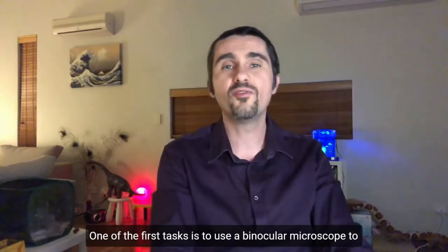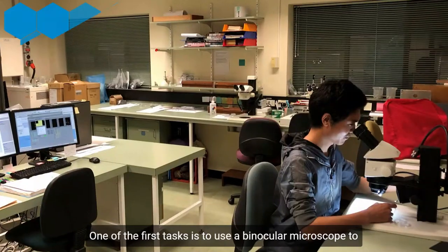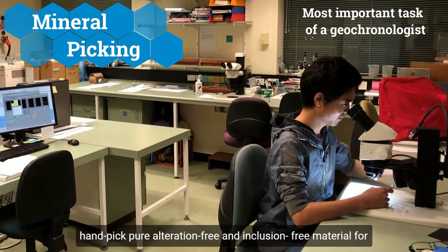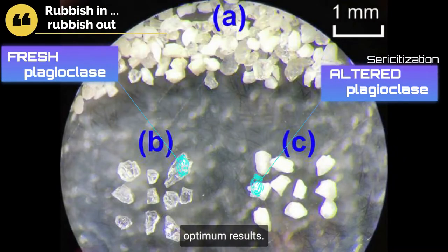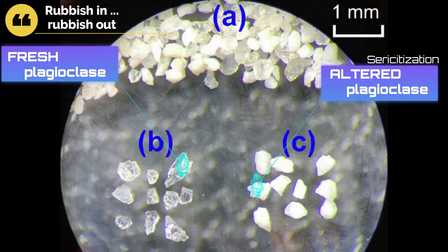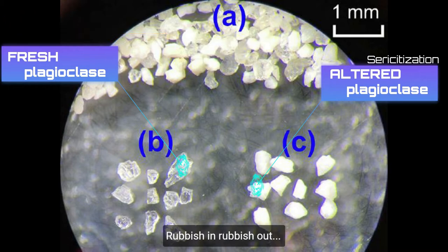One of the first tasks is to use a binocular microscope to hand-pick pure, alteration-free and inclusion-free materials for optimum results. You know what they say: rubbish in, rubbish out.